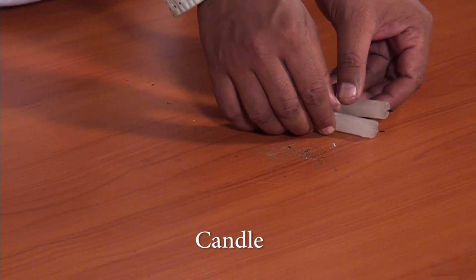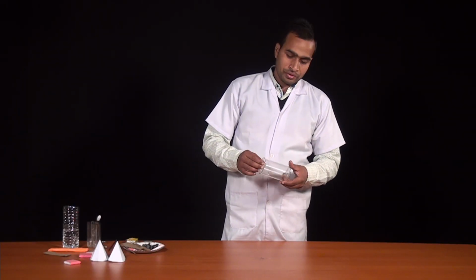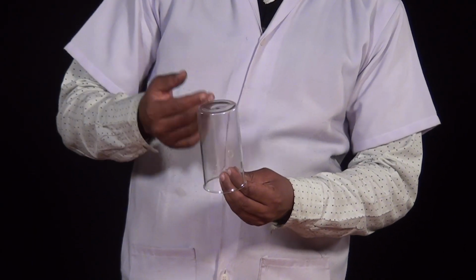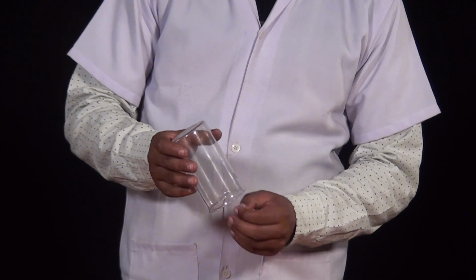In this activity we are also going to use a candle, and I have collected these small pieces of candle. You can also use candles of different colors and sizes. We will use this beaker for covering the flame of the candle.